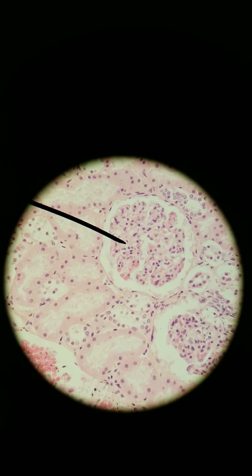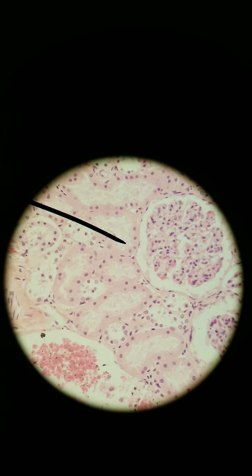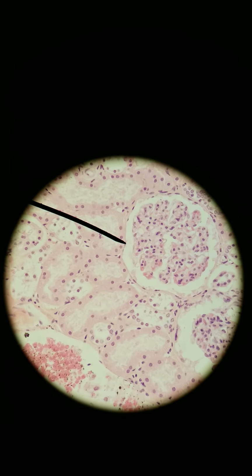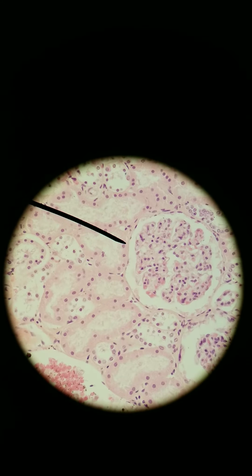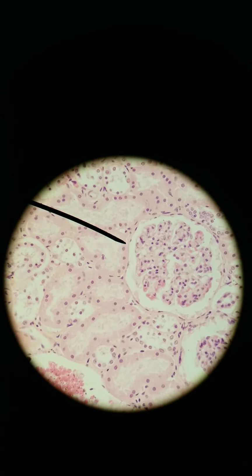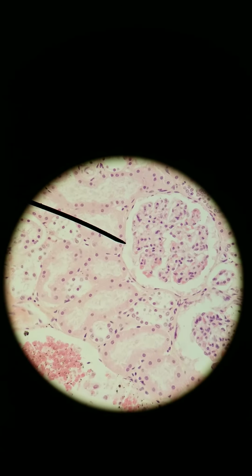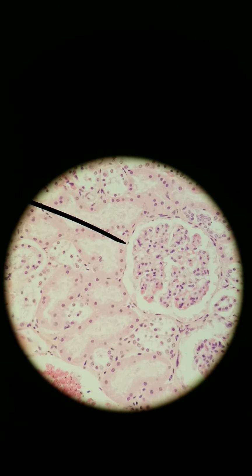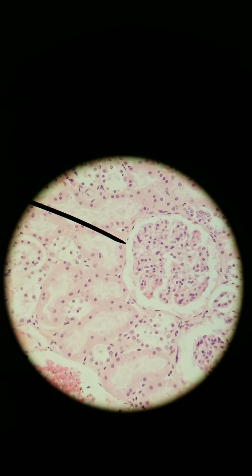All right, so which ones are the squamous cells? Since we're looking for longitudinal cut cells, we need to look for thin, flat cells. Not the ones that look like pancakes like before, from a top-down view. We want the side view. Where I'm pointing my arrow right now, that is a nucleus of a very, very thin, flat cell. All of this is just one cell. It's lining the white space. This white space is a lumen. So this is the nucleus where the arrow is right now. Here's the membrane, very, very thin and flat.